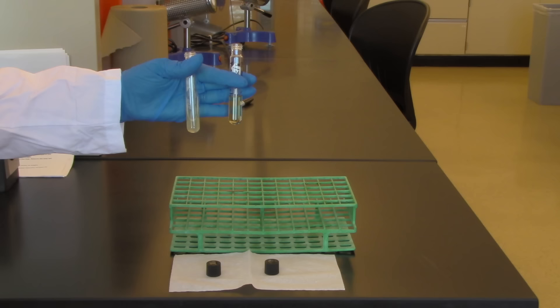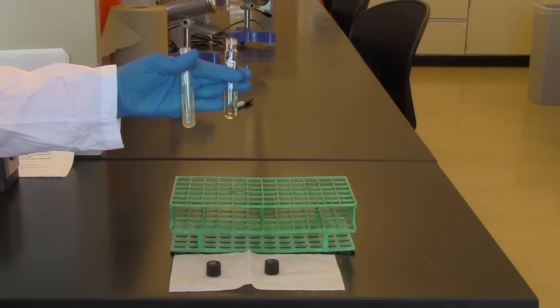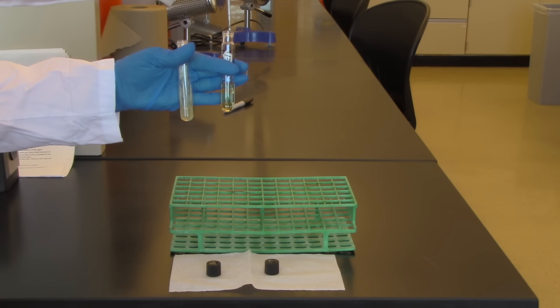Take that out and I'm going to transfer that over to my broth. Give it a little tap. You don't need to shake it. Just a little tap.